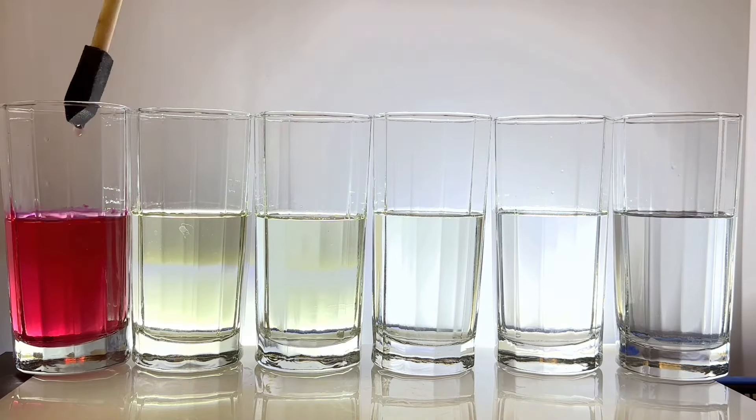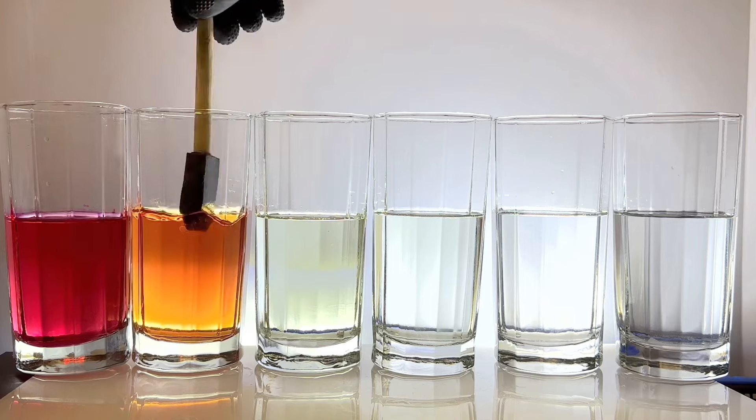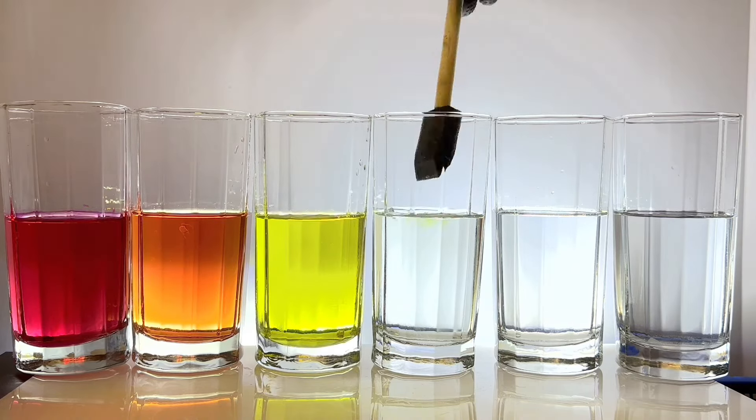You can also run this experiment in the opposite direction, generating all the colors of the rainbow in fluid that pretty much looks like water.